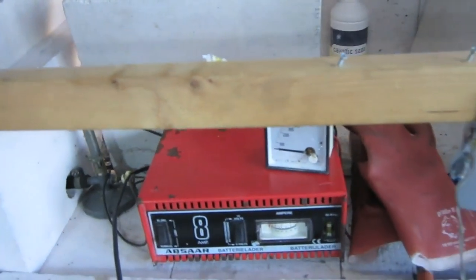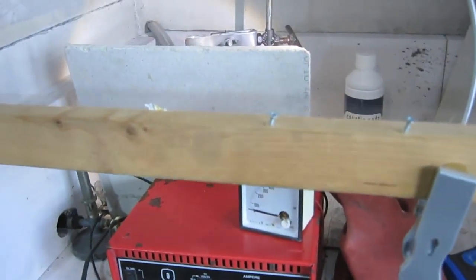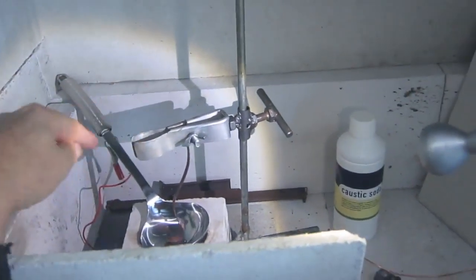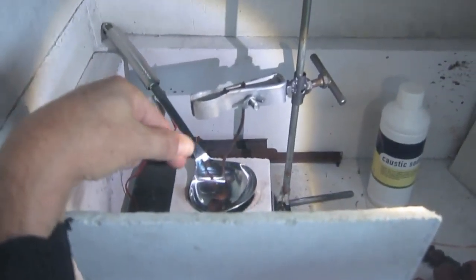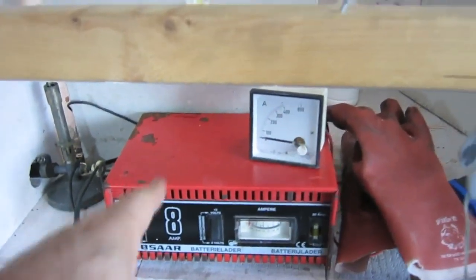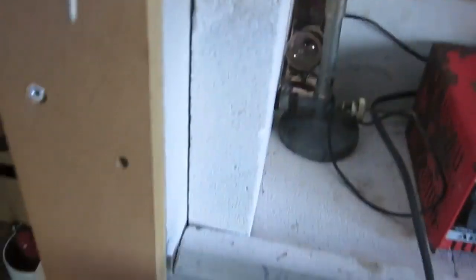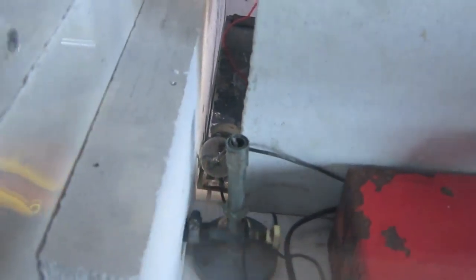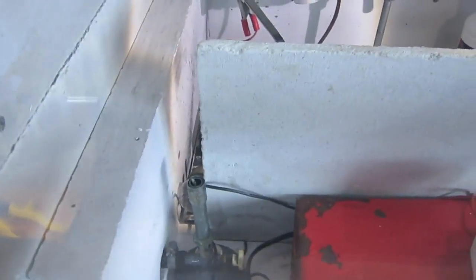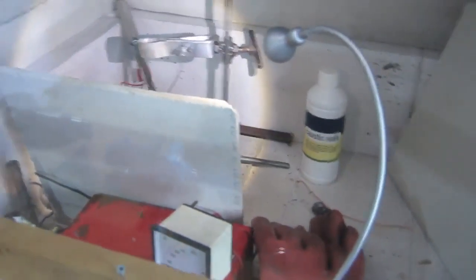This experiment I'm going to try to electrolyze NaOH caustic soda, sodium hydroxide, and I hope to get some sodium metal at the cathode. So this is the anode — the stainless steel soup dipper is the anode — and this is the cathode. This is the power supply, just a battery charger. For safety, to prevent short circuiting, I put a halogen bulb in series, so when the electrodes touch each other the halogen bulb will ignite instead of short circuiting.